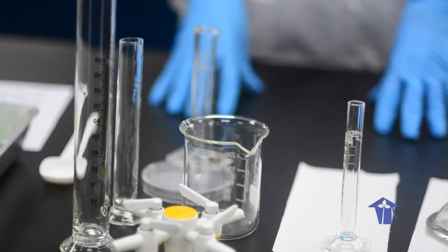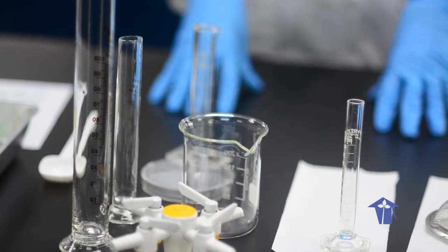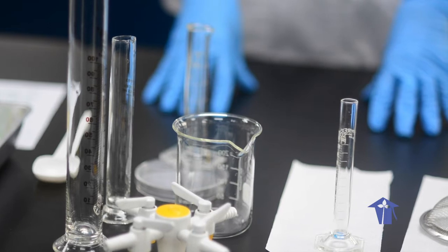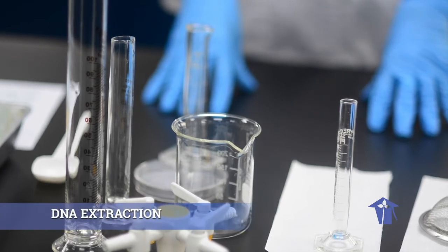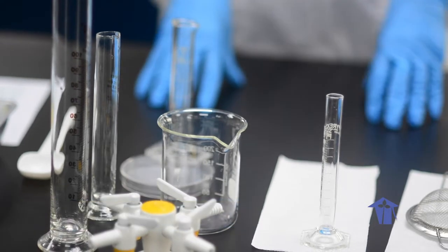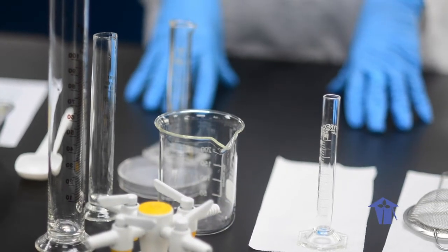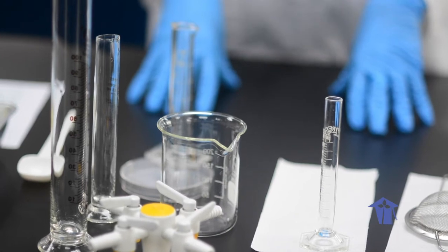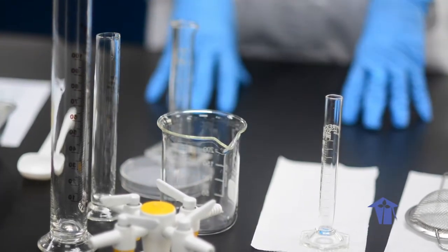Before starting this lab procedure, make sure that you read all of the safety information that is provided for you. Very important, there should be no open flames anywhere near to the setup of your experiment.